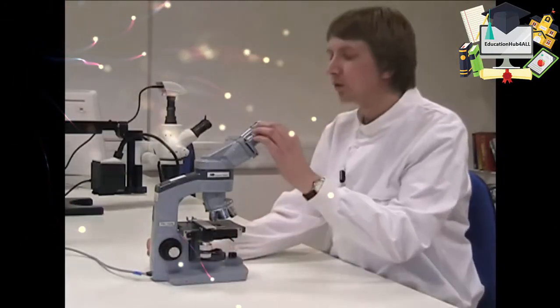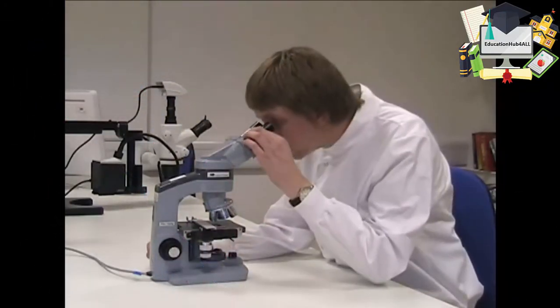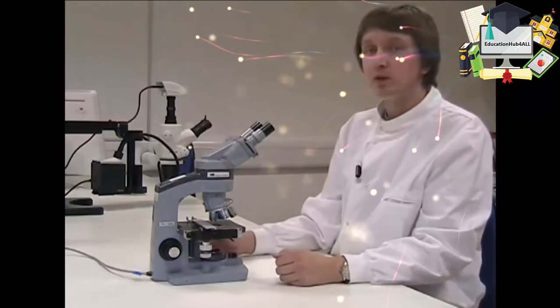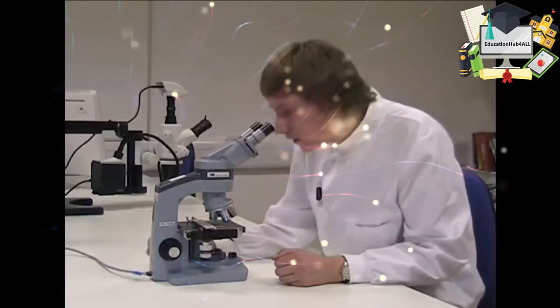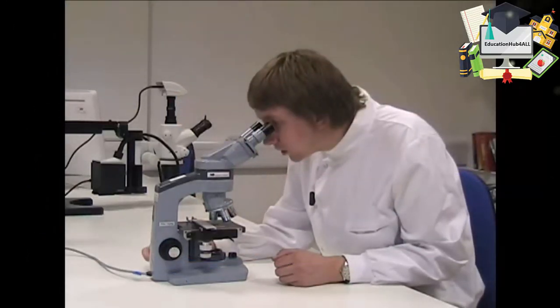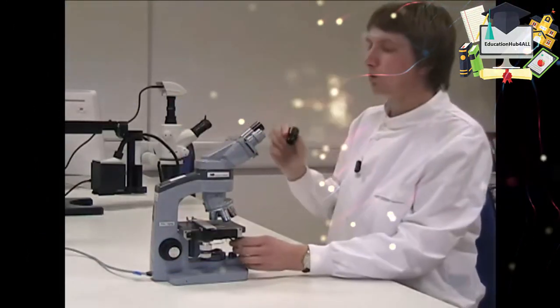And when you want to move to a higher magnification, move to the next objective lens, refocus and also readjust the illumination system.